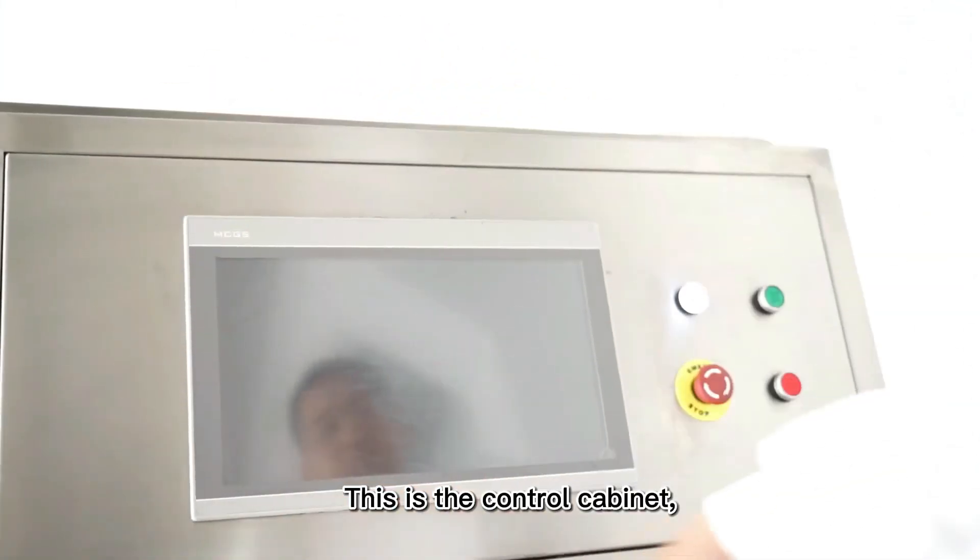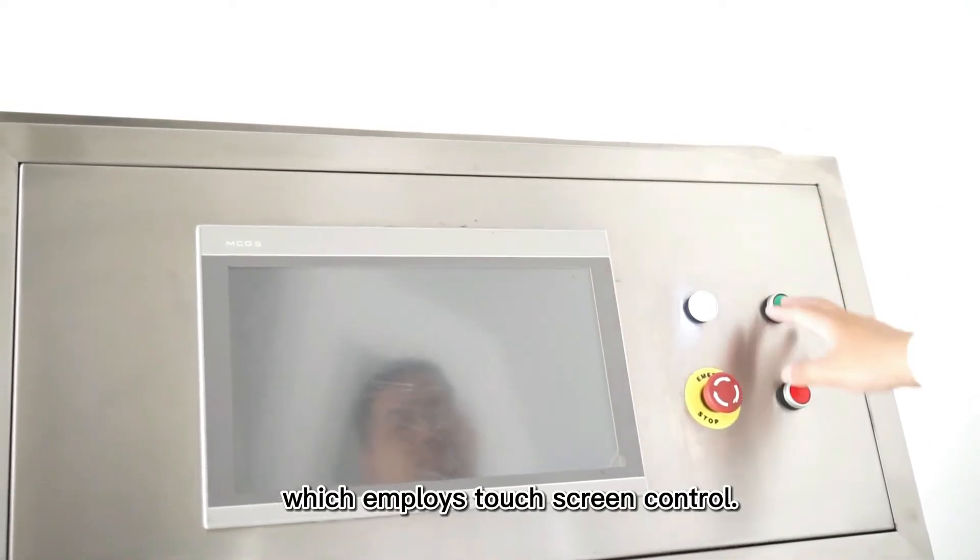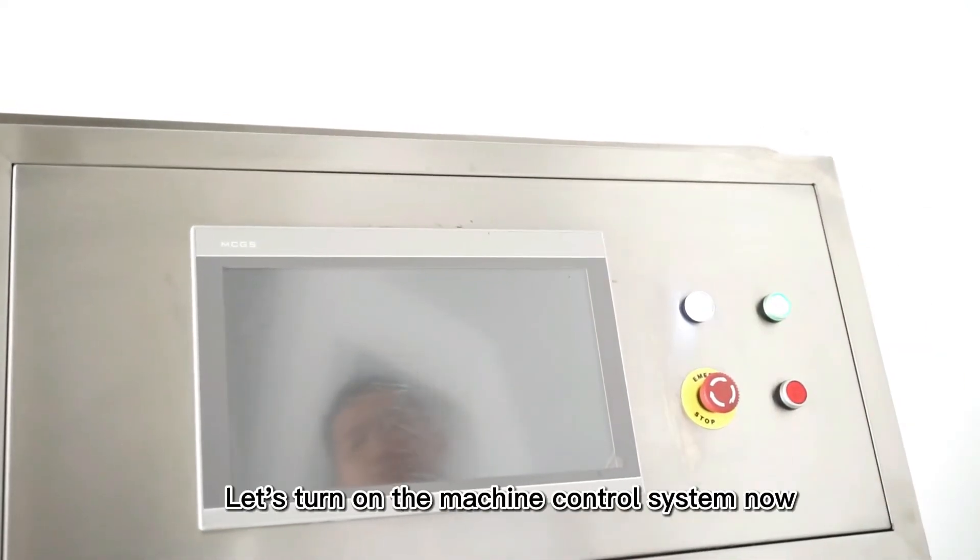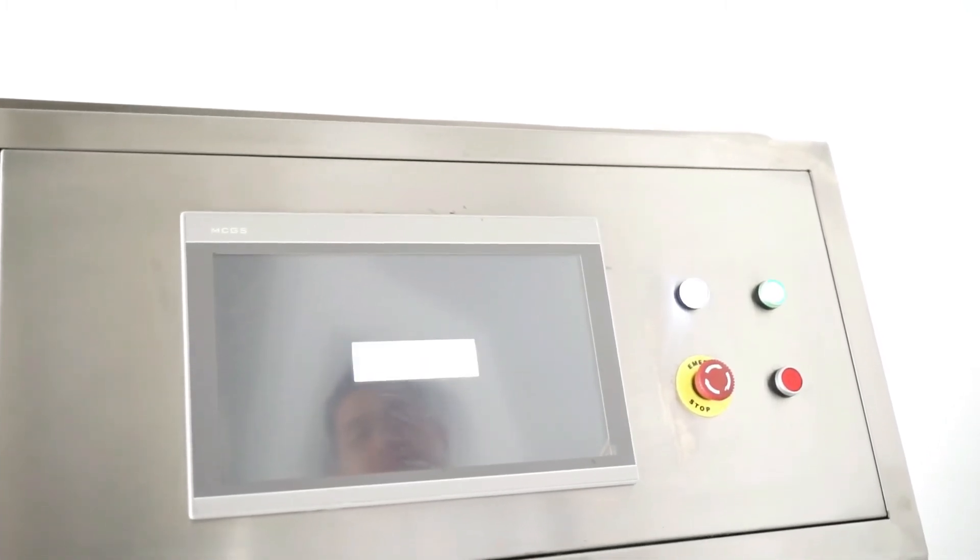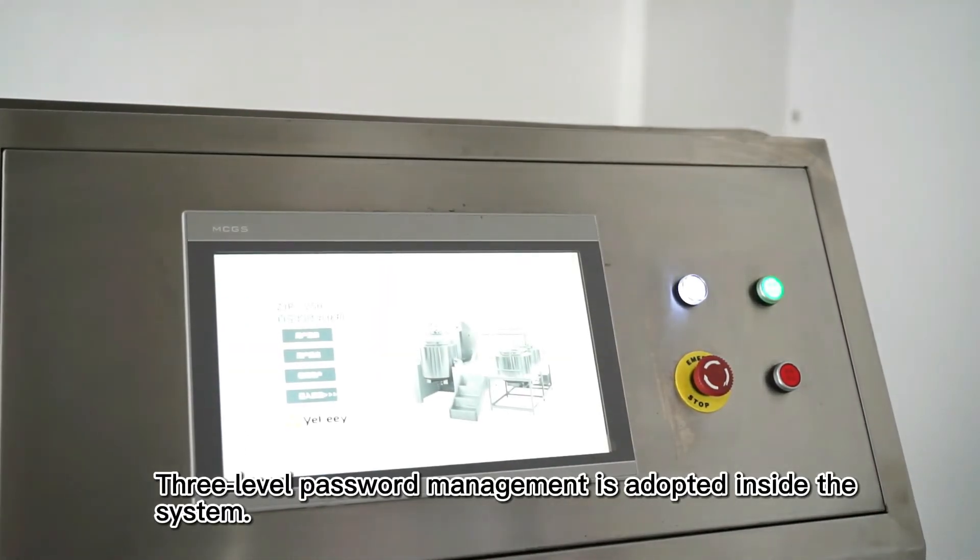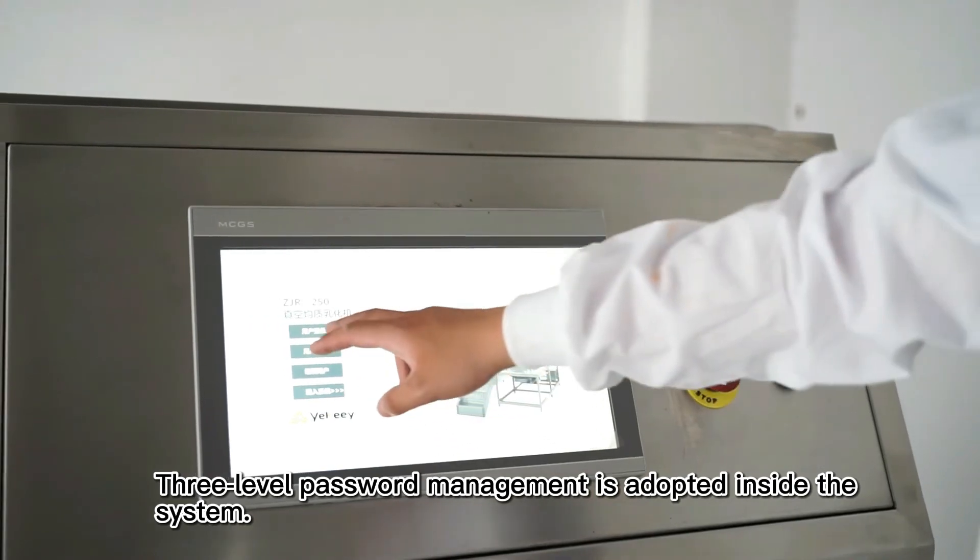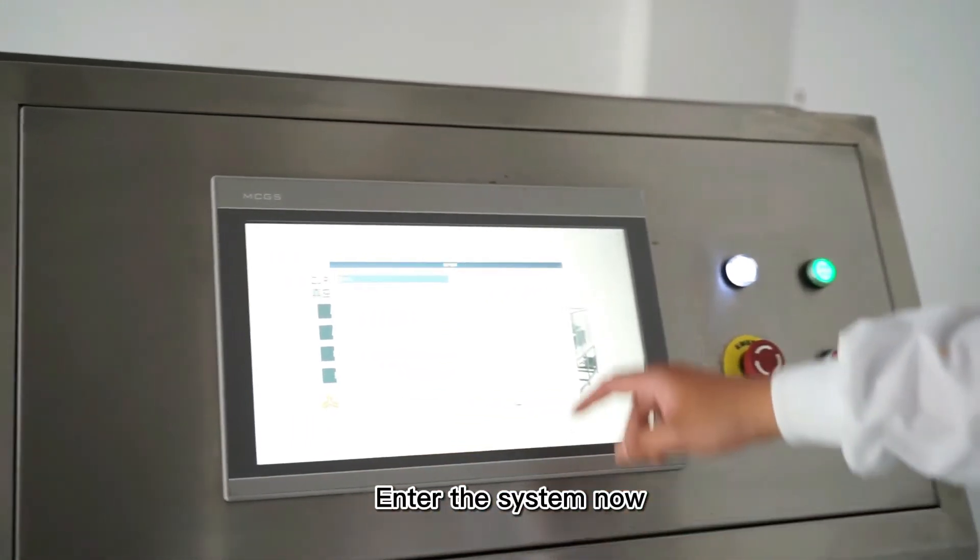This is the control cabinet, which employs touch screen control. Let's turn on the machine control system here. Three-level password management is adopted inside the system. Enter the system here.